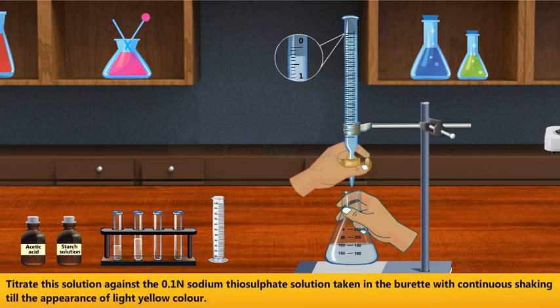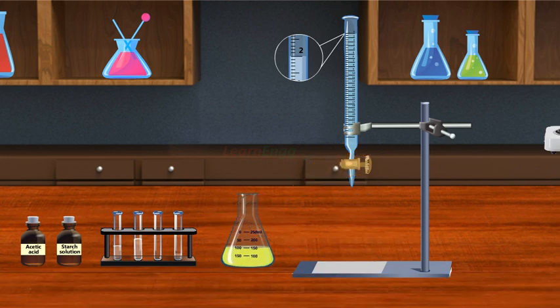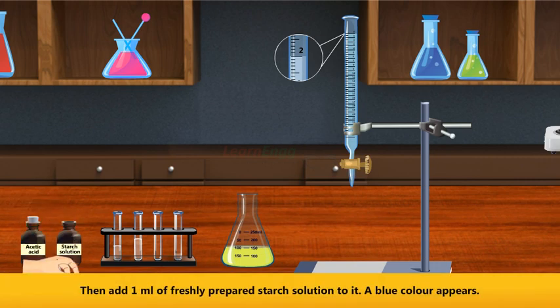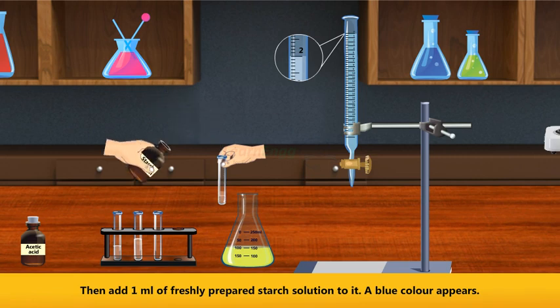Titrate this solution against 0.1 normality of sodium thiosulfate solution taken in the burette with continuous shaking till the appearance of light yellow color. Then add 1 ml of freshly prepared starch solution to it. A blue color appears.